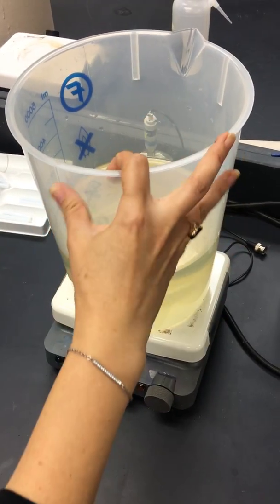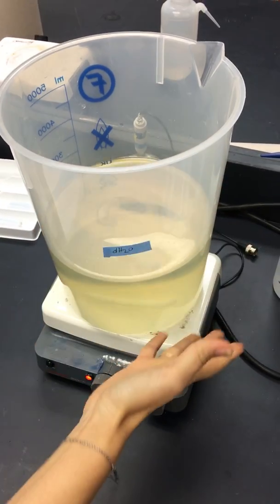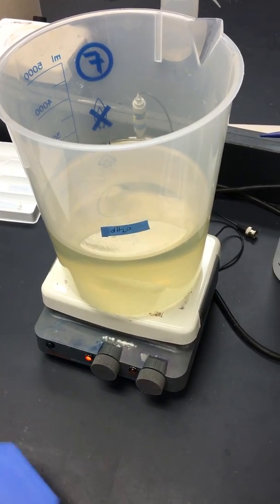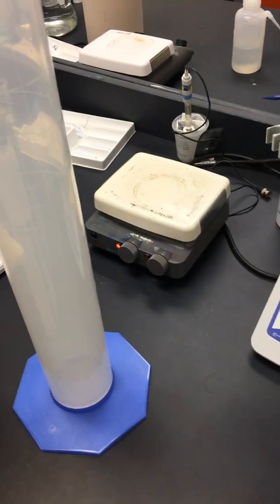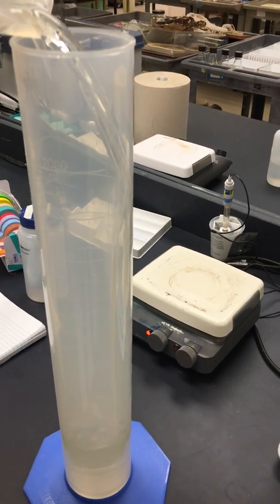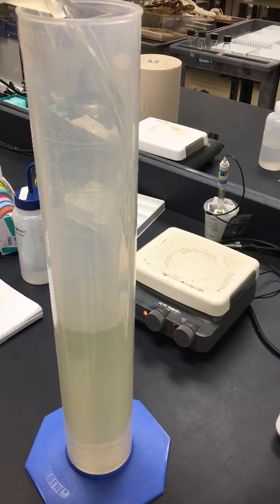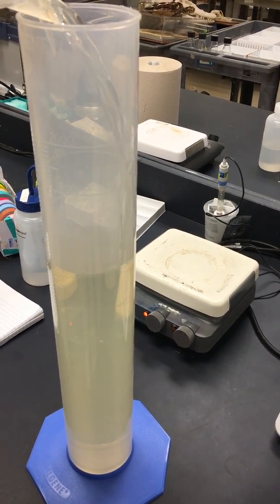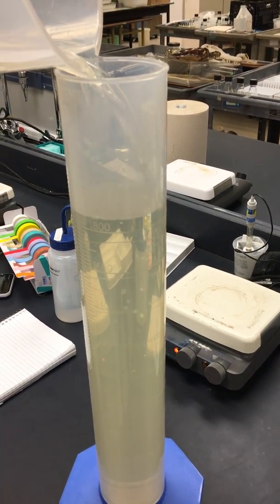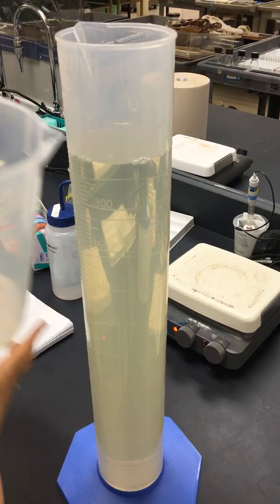As you can tell, this has been sitting about 10 minutes and all the sugar has gone into solution. Now I'm going to measure out the 2000. You have to do this part kind of slowly — you don't want to be spilling any sugar anywhere because then it gets very sticky everywhere, and then we all walk around with our sticky feet.